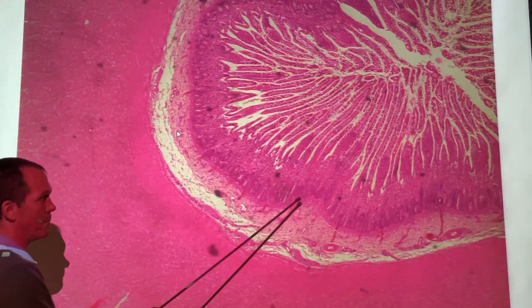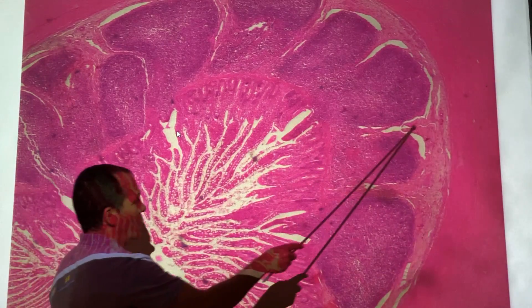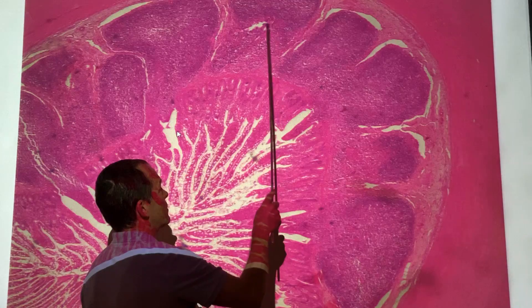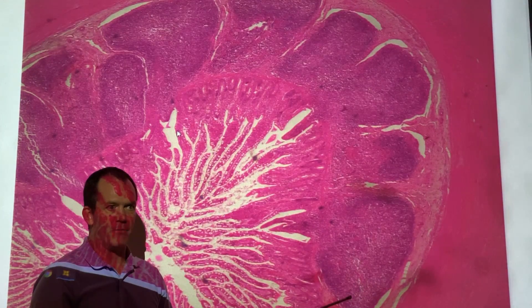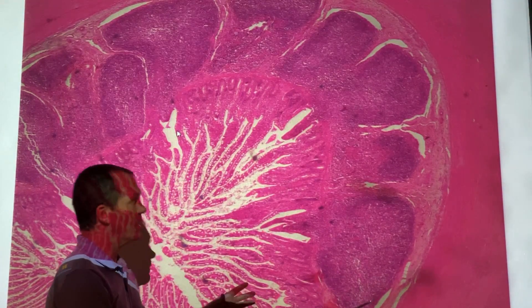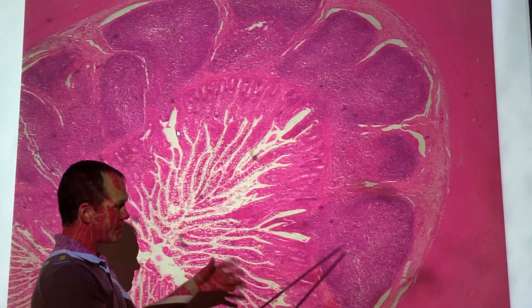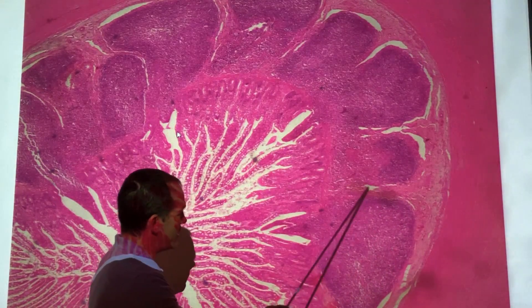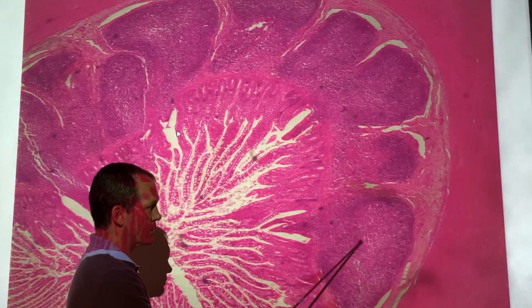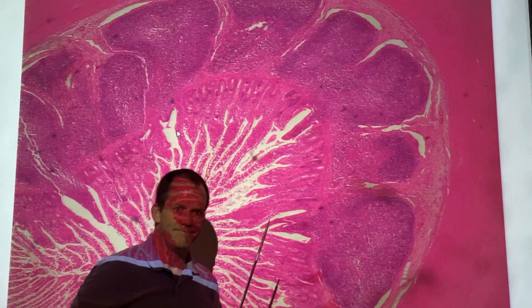The interesting thing about the ileum is that if you go just a bit northeast on the slide, we see some definite oddballs. These big bubbles of stuff — these are Peyer's patches. These are aggregations of lymphoid tissue located in the ileum, really close to your large intestine. Your large intestine has a lot of bacteria in it, and you don't want those bacteria migrating into your small intestine. So you have lots of lymphocytes and macrophages here to clean up the area if anything tries to invade. This is still the submucosal layer, but these particular structures — Peyer's patches — are very recognizable.